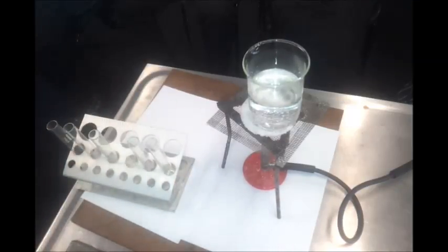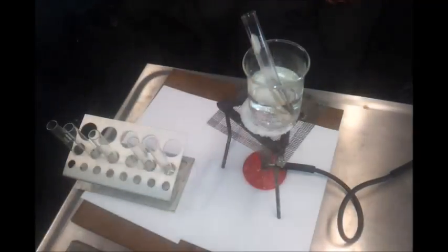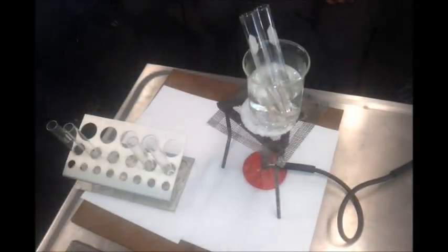Okay, the next one I'm going to look at is a couple of reactions called oxidation reduction. So that's going to be our focus for today. And in two test tubes, I'm going to have ethanol being heated up. So I'm going to put it in a water bath so that it's not directly next to a naked flame. And I'm just heating it up so that there's no waiting around for the rate of reaction. There's no requirement to do it really. It'll react anyway. I just want it to go a little bit faster, so I'm heating it up.